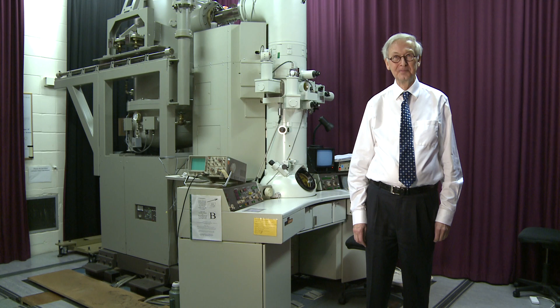The easiest way to think of an electron microscope is to start by thinking of a light microscope. In a light microscope, you have a source of light, like a light bulb, and then there are lenses which focus that light onto the specimen, and you get wonderful images. But a light microscope has two disadvantages.